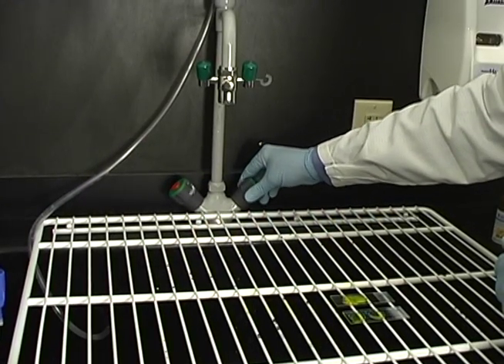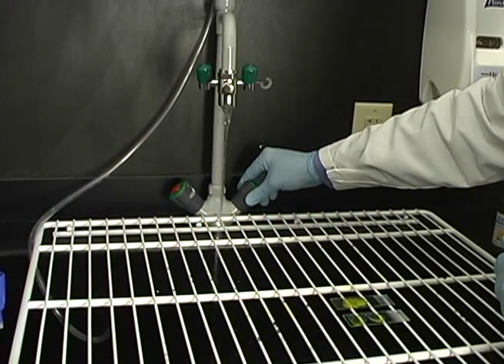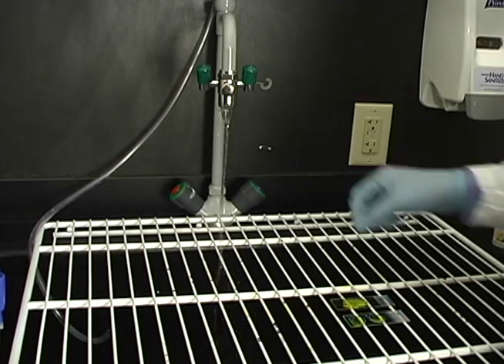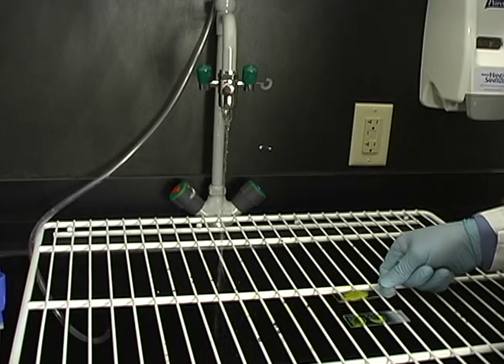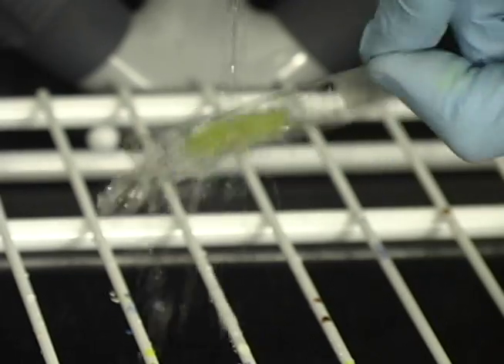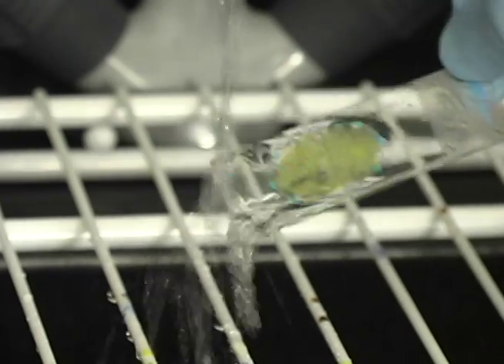Rinse each slide with water, completely removing the stain. Use sterile water if possible. Be careful to not forcibly wash off and potentially remove the specimen. Gently shake off any excess water.